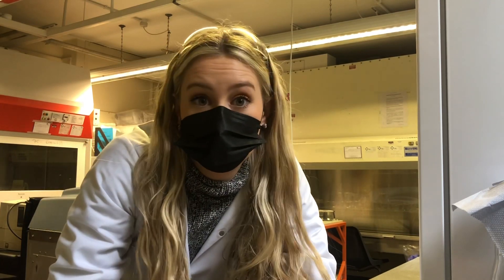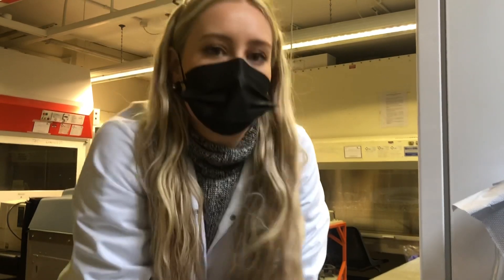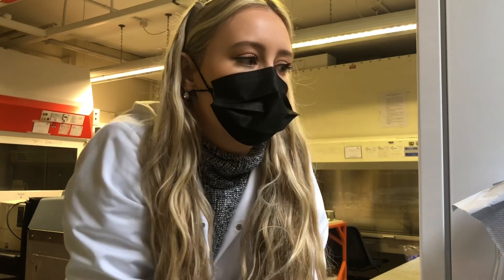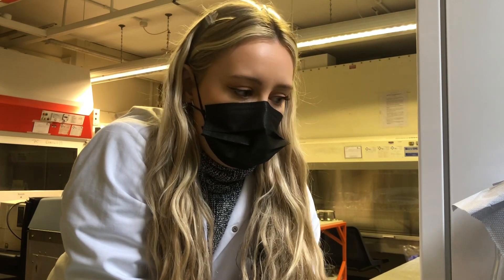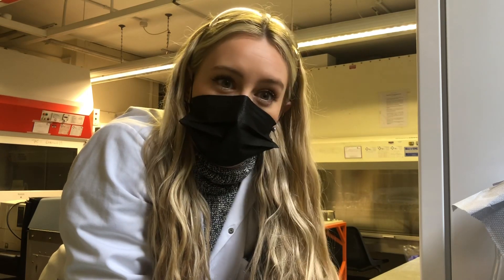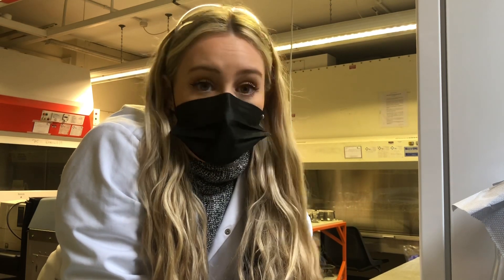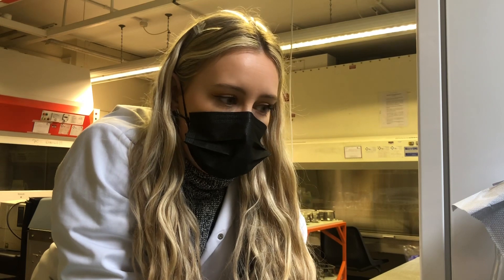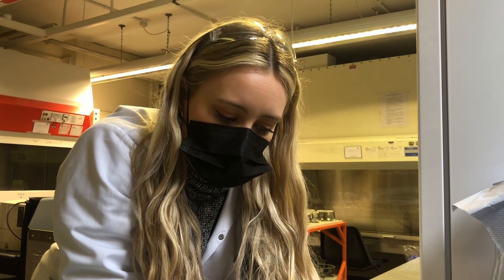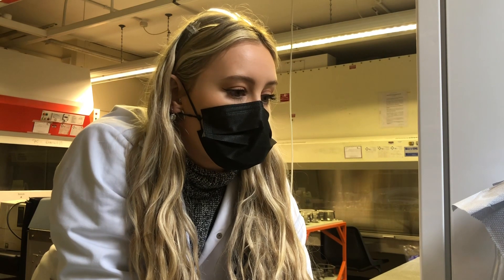I am crouching down because I can't find a good place to put the tripod. I again left my bacteria to grow in the plates and I just tapped them out and washed the wells. I'm kind of having to improvise because we can't get into our chemistry lab today and tomorrow, but we were only told yesterday. So I had to remove all the stuff from the chemistry lab and bring it down here to the micro lab. Usually to dry my plates I would put them in an oven at 60 degrees, which basically fixes the biofilm to the bottom of the well - it dries out all the liquid and it's just the biofilm dried down left behind. But I don't have access to that oven, so I'm going to try and air dry my wells using tinfoil to cover them so they don't get any debris in them.